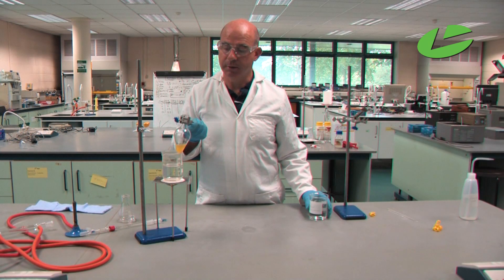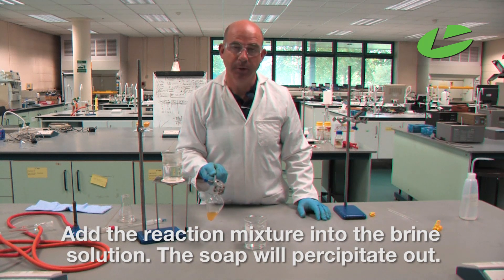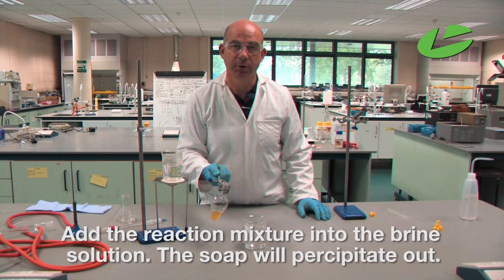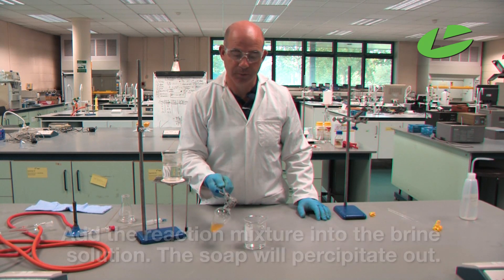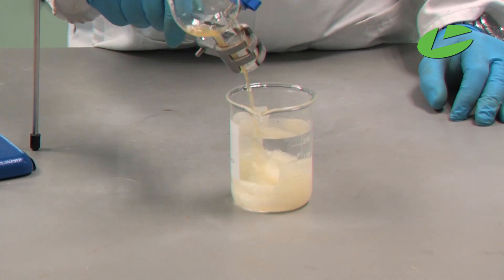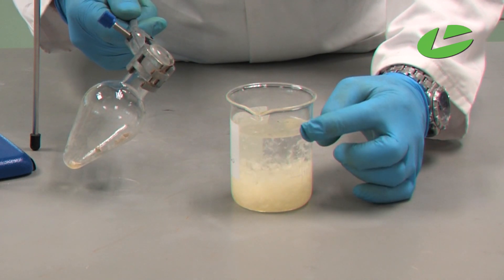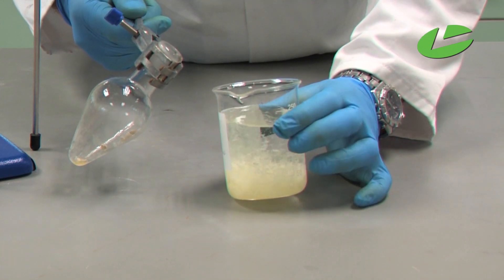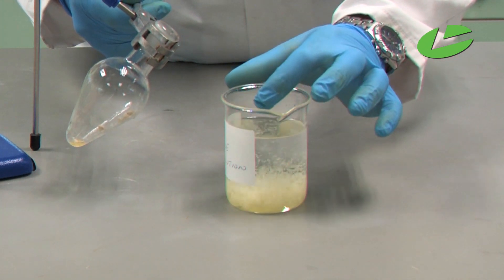I'm now going to precipitate the soap by adding the reaction mixture into the brine solution. The soap will float on top of the solution whereas the unwanted side products will dissolve into the solution. We can see the soap precipitating, and on top of the solution you can see a thin film of the soap.